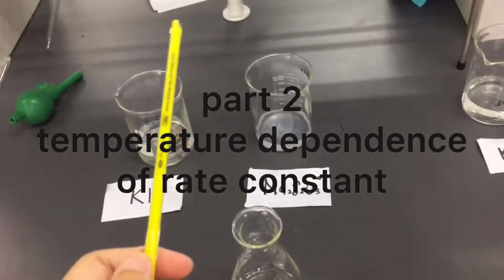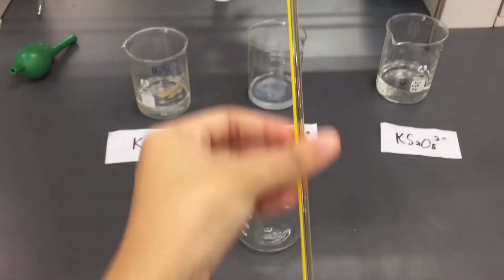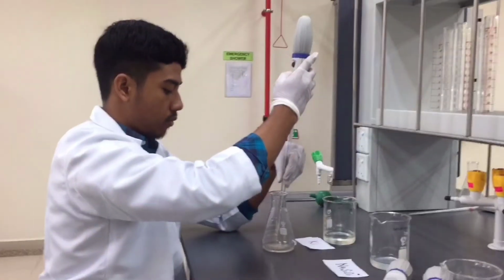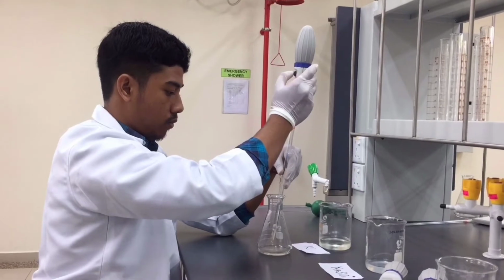Now we proceed to the second part of the experiment, which is the temperature dependency of the rate constant. This experiment is divided into three parts. The first one is at room temperature, the second is cold, and the third one is hot. For this round of the experiment, we are going to use the reference reaction mixture that we did in trial 1. So, we need 3 conical flasks.